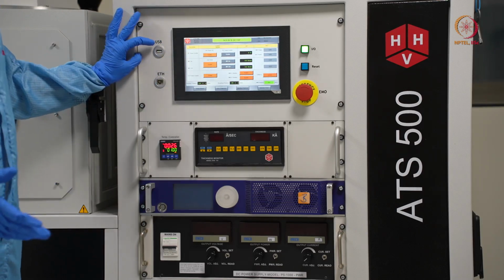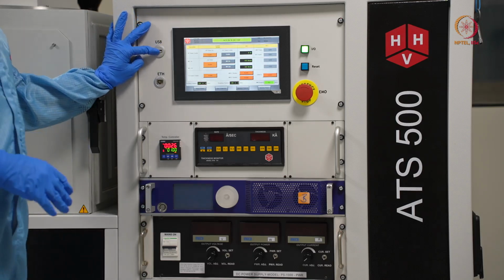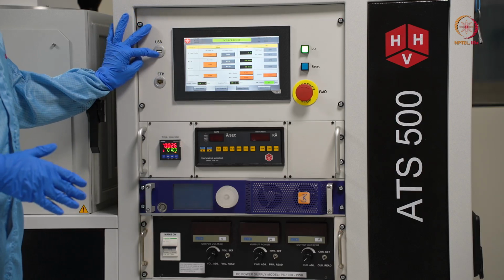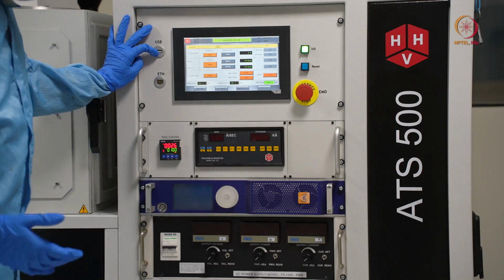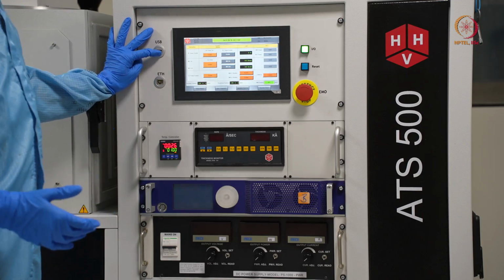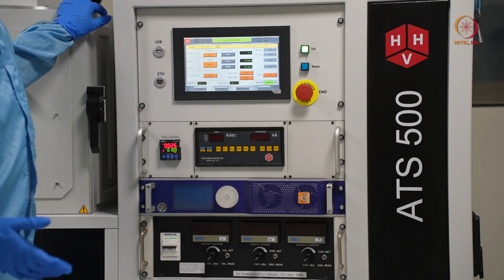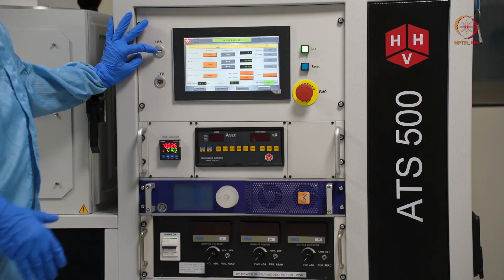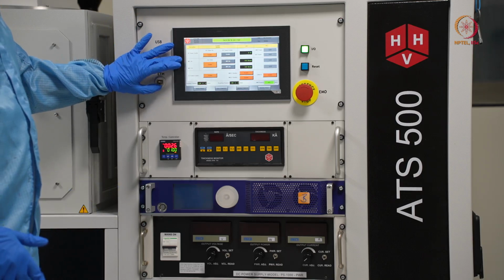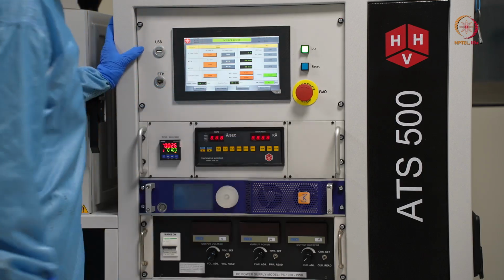Whatever we want to choose, we choose accordingly. Here we don't want to deposit any oxide. We are using our DC supply to first deposit tungsten. That is a metal, so we don't need any oxygen in the environment and will do it with argon only. Before that, the first thing is we will switch on the DTM.